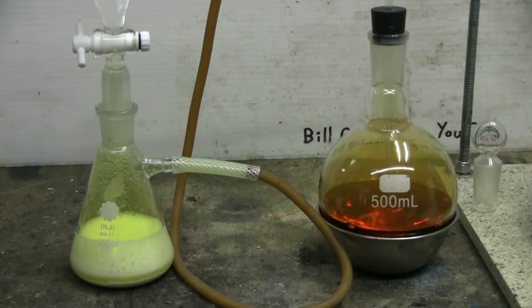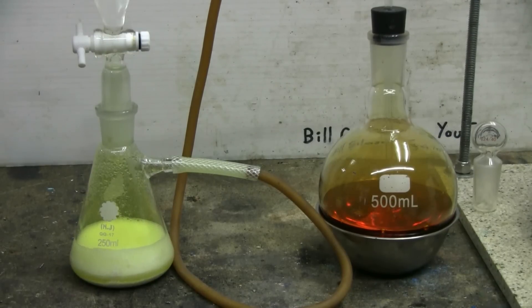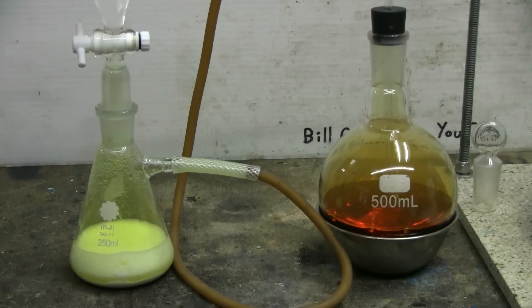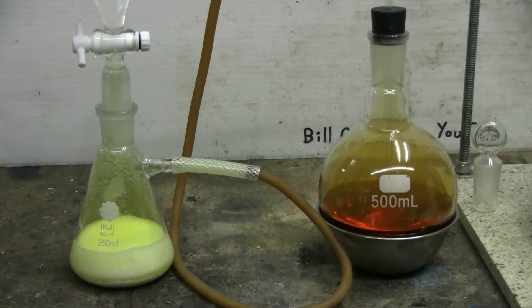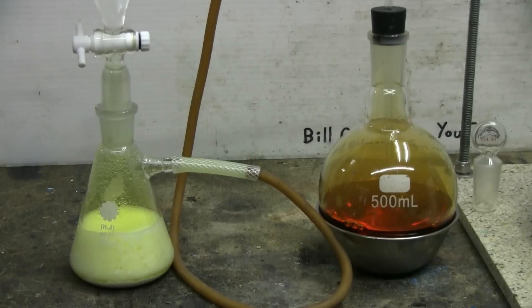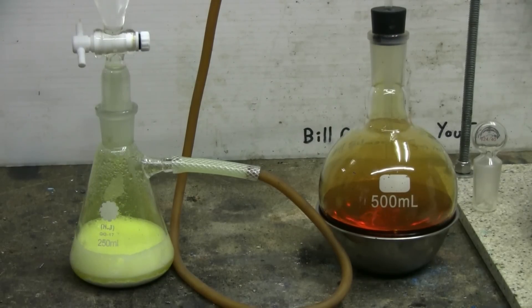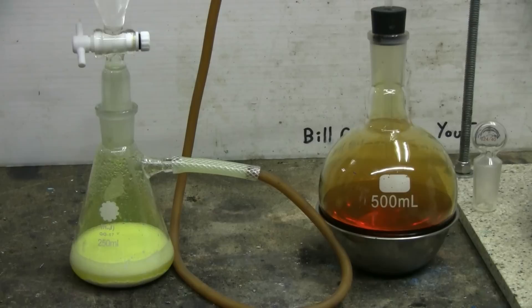This experiment has to be done with high-powered ventilation. I'm running mine right now - you may be able to hear the roar of the ventilation system in the background. Ventilation is so good here that I can't smell any chlorine or any bromine, and that's the way it has to be for safety with these poisonous and potentially dangerous gases. Bromine is a liquid at room temperature, but a little bit of heat and it will quite happily evaporate and potentially fill the room with gagging, sick, poisonous fumes.